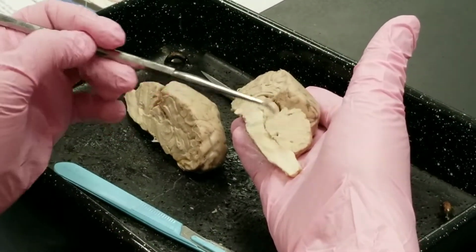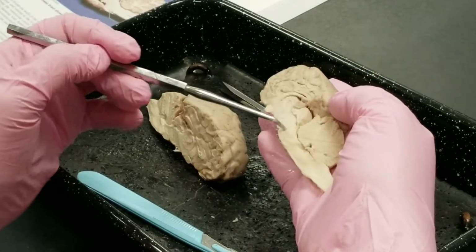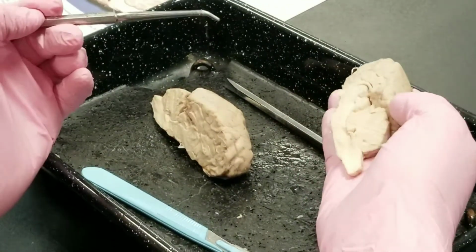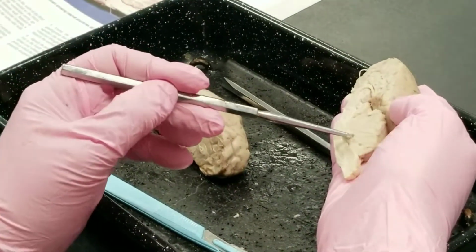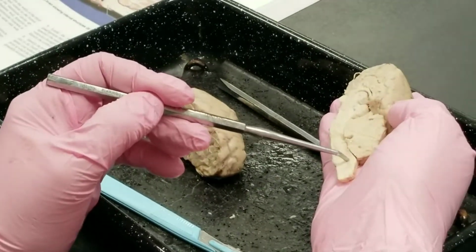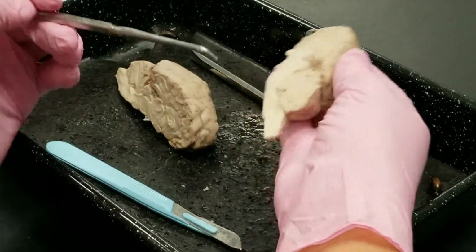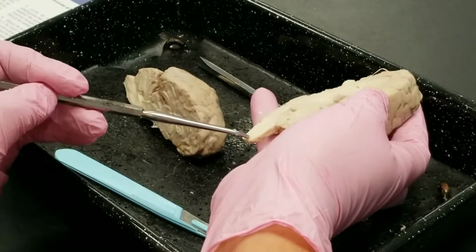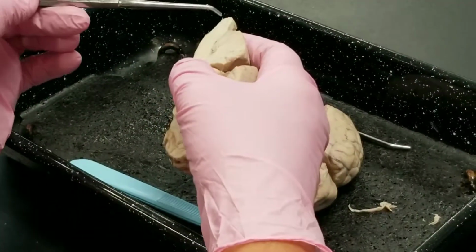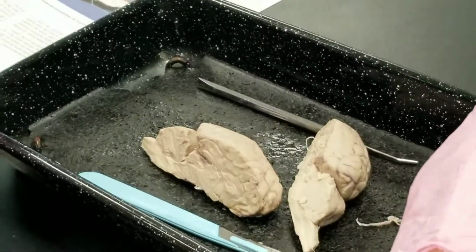Now, that's the cerebellum. But where's the rest of the brainstem? So remember, the brainstem is the midbrain, the first bump is the pons, and the second bump is the medulla oblongata. CSF, when it flows from the fourth ventricle, flows down the central canal of the spinal cord. It's not very pronounced here, but you can kind of see the groove. Can you kind of see the groove where it goes right here? Oh, here. Better here. There's the groove. Okay? And that's it. Not that much.